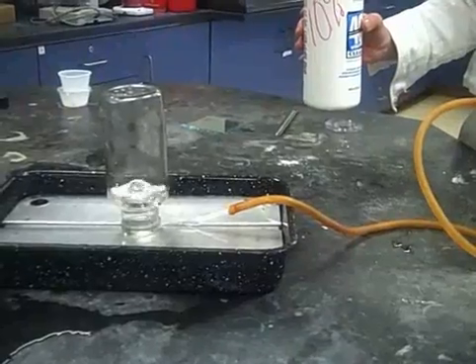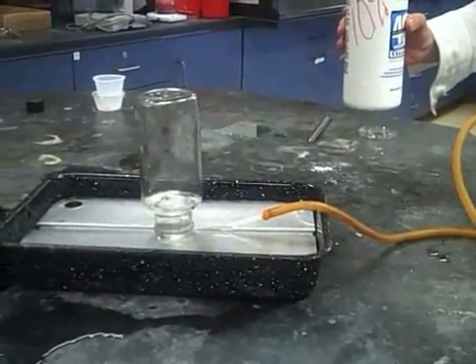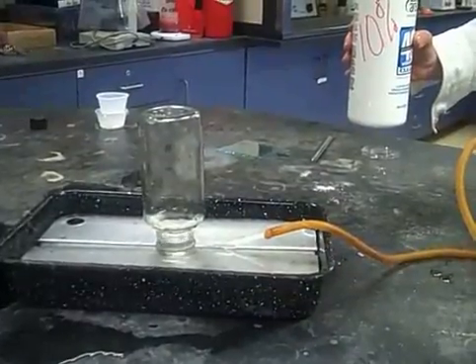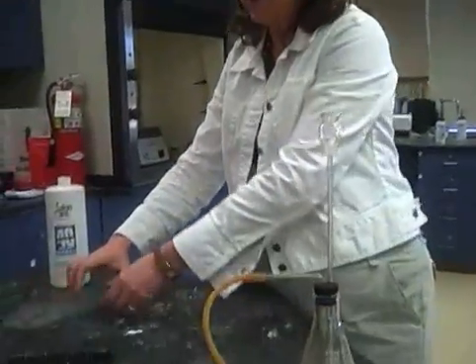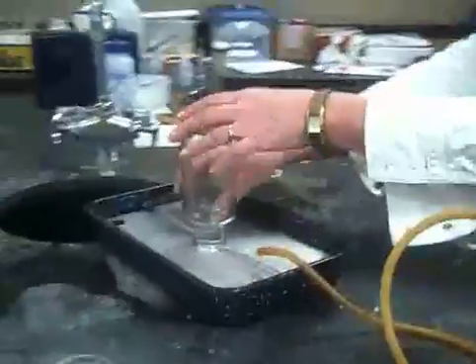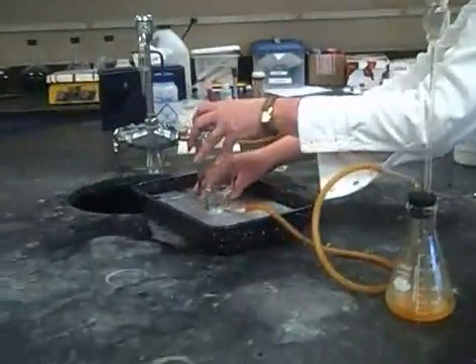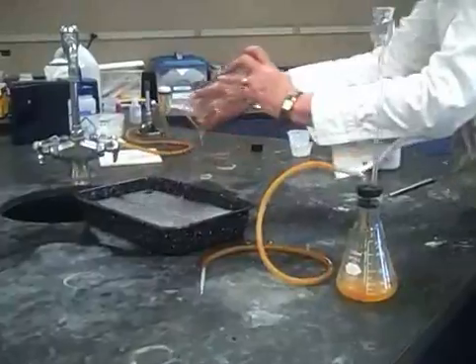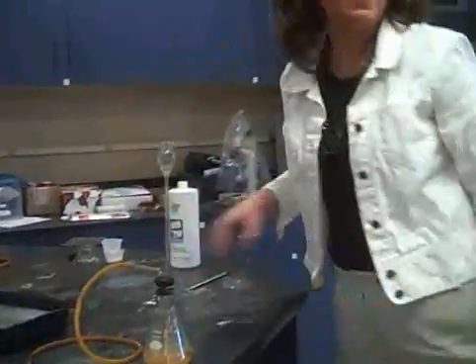Don't bother adding more hydrogen peroxide unless it stops bubbling — it's bubbling just fine. So now I'm ready to take the bottle out, and I'm going to go ahead and put the glass plate under here, lift the bottle, and invert it.